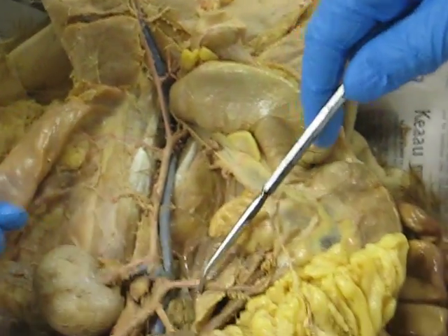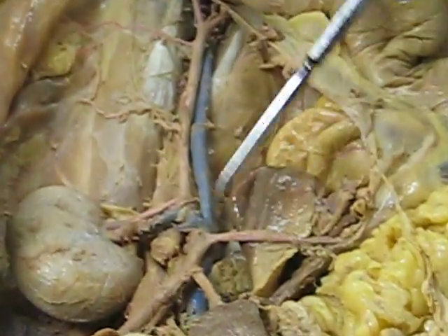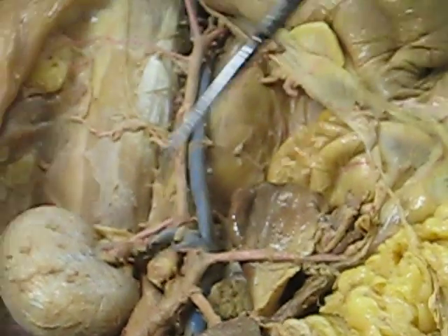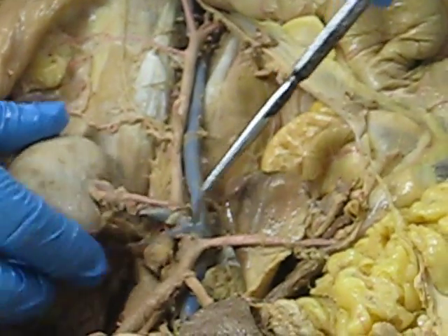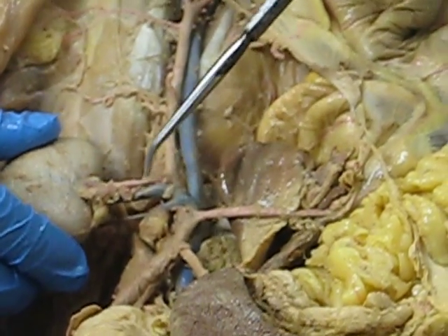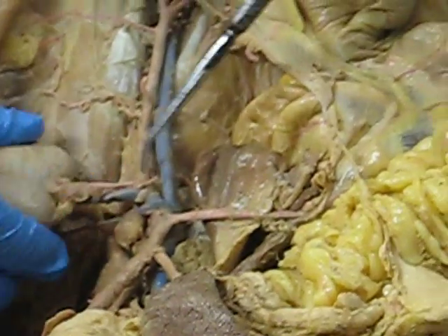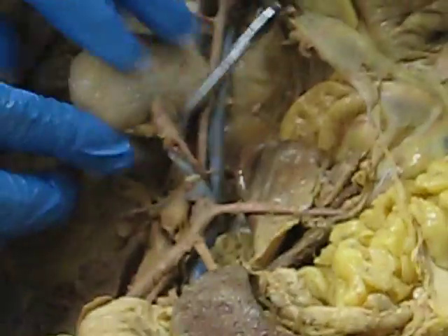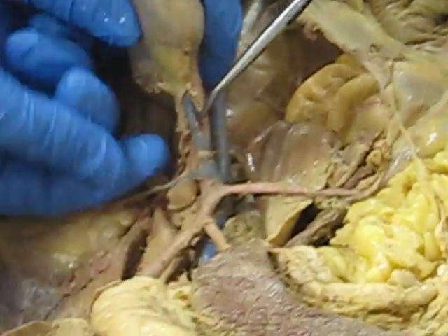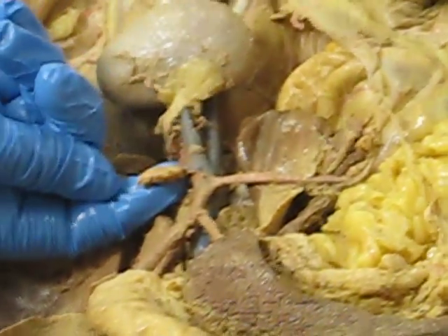There we have the superior mesenteric artery. Going down, we have the renal artery that branches off the aorta, and also the adrenal gland right there.